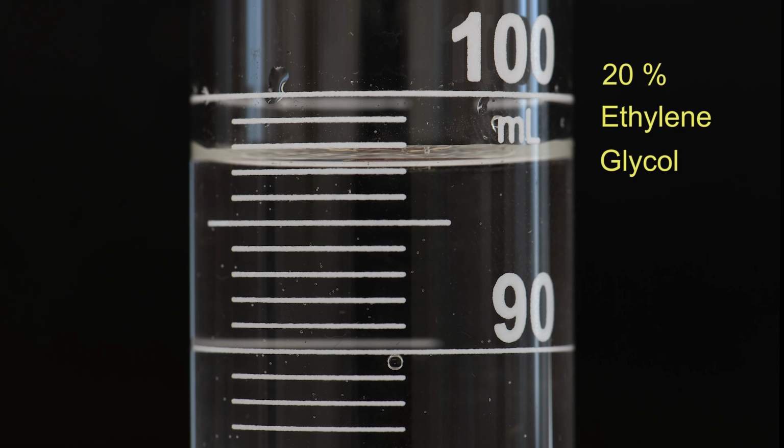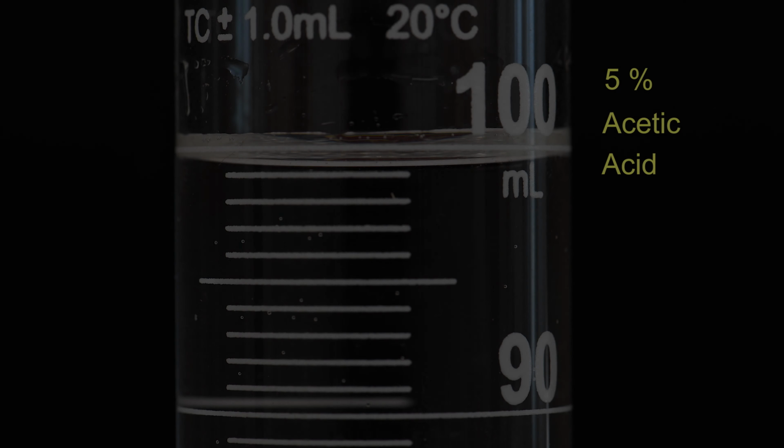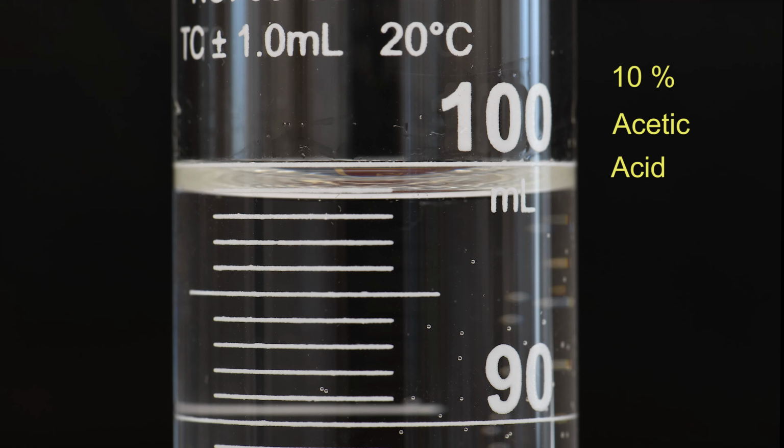And finally, 20%. Our last series will be acetic acid, and this is the 5% solution. And this is the 10% solution.